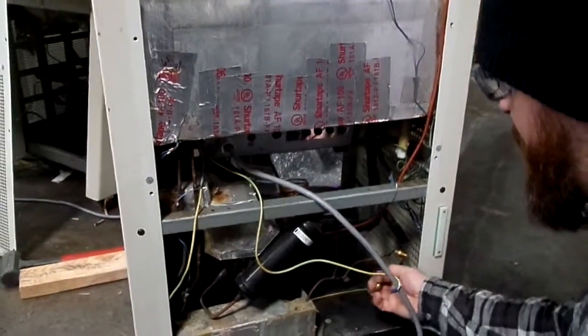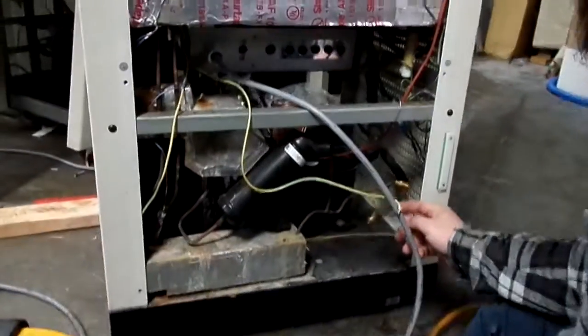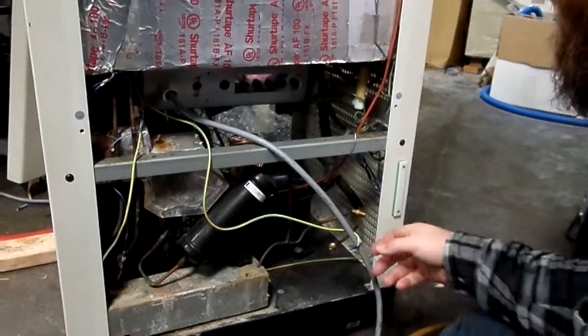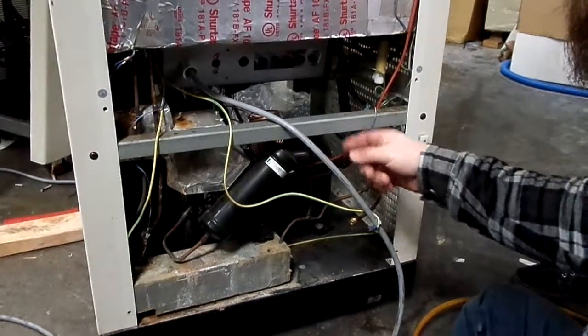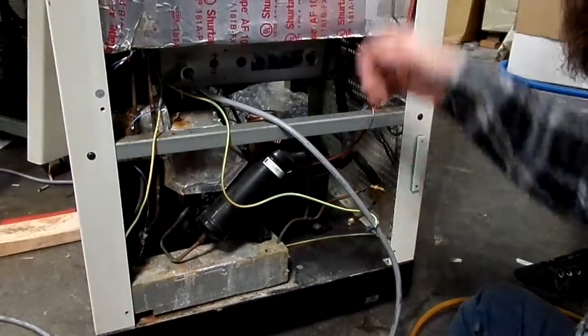Now, the suction, or the low side, will almost always be going straight to the compressor. All it does is an intake. It's a place to add refrigerant and check pressures. The high side will always be somewhere in line after the compressor, before the chamber.